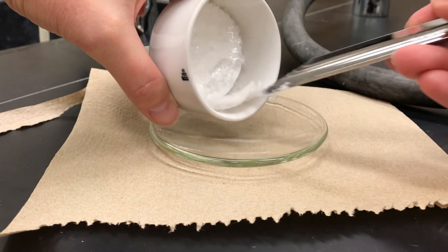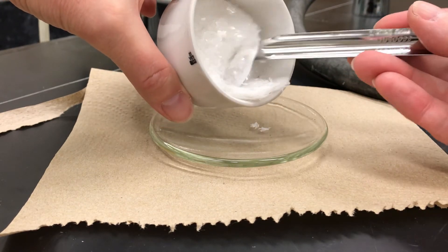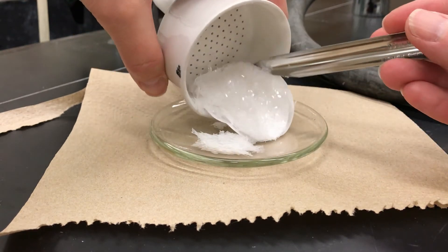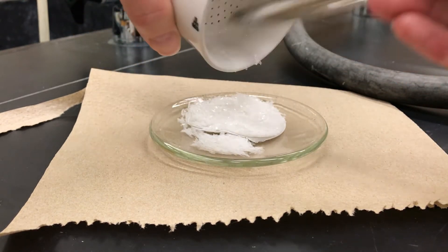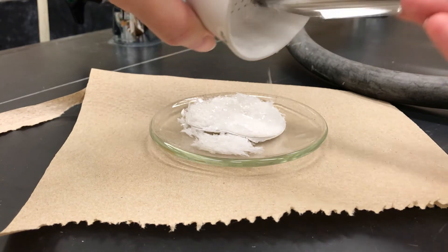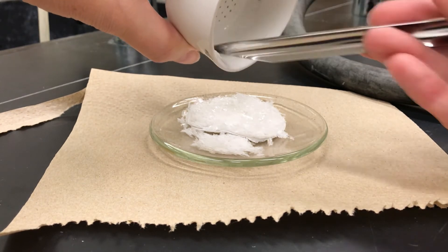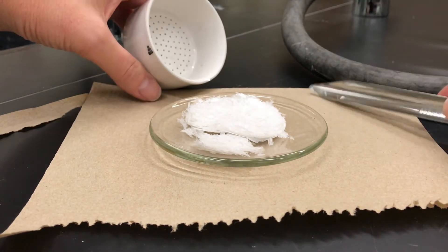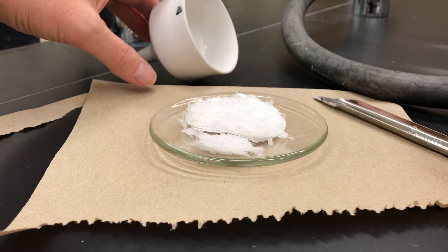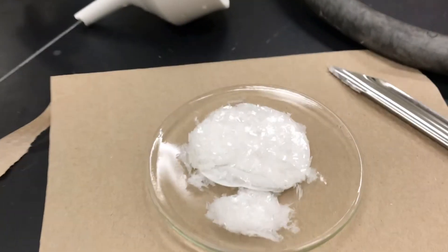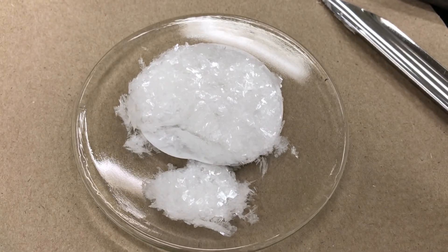It's tough to scrape off the solid from the filter paper when it's wet, but if you let it dry overnight, it's going to scrape off so much easier the next day. So put both the solid and the filter paper onto watch glass. Let that dry. And here's our beautiful solid that we've collected through suction filtration.